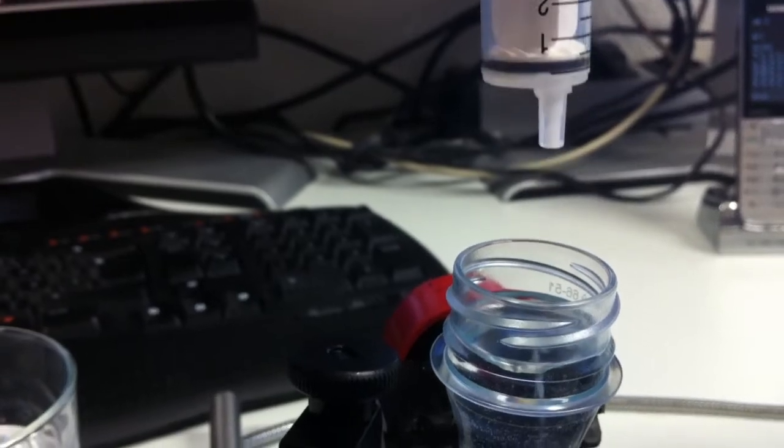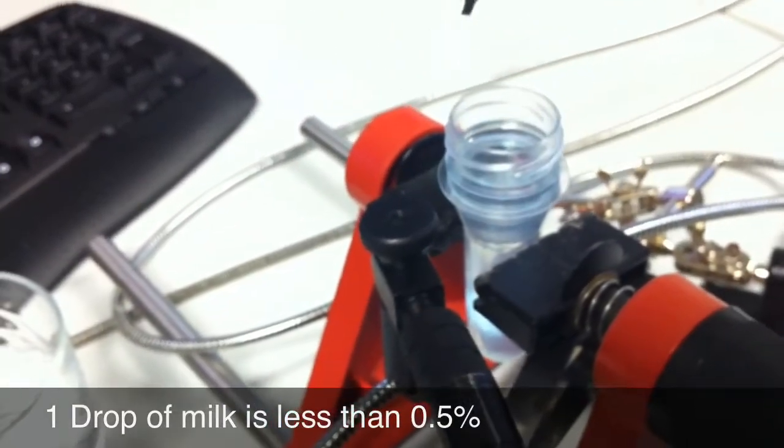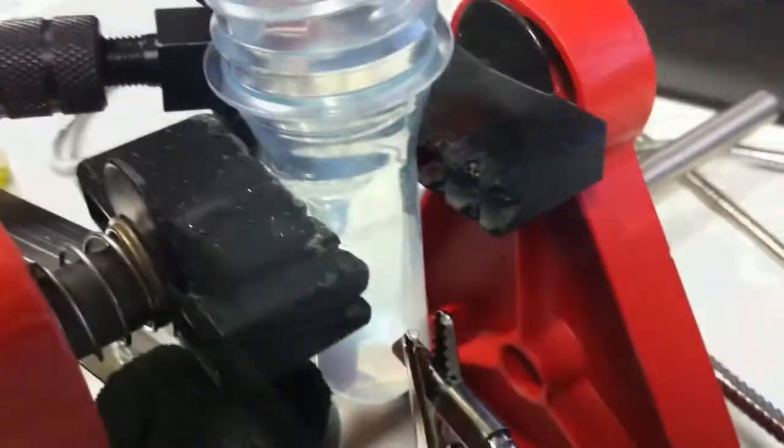So then I took only one drop of milk, mixed it and you see it's a little bit milky now.